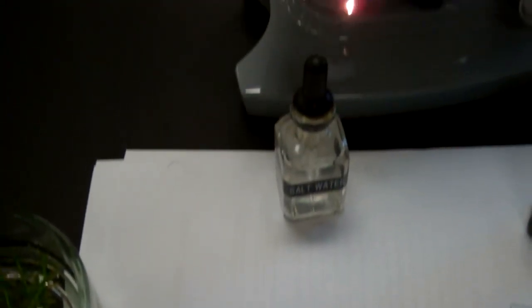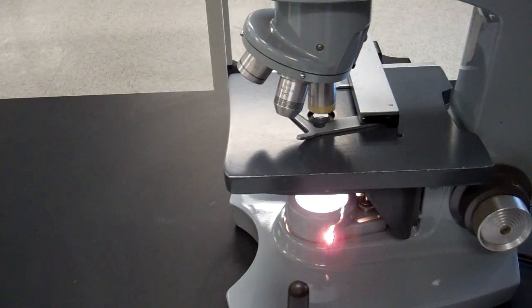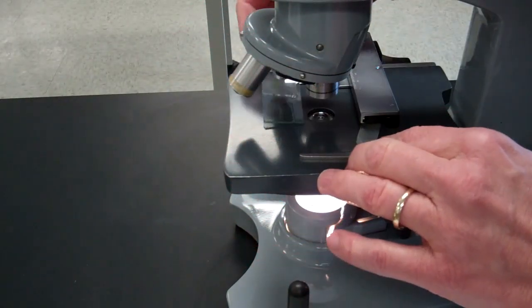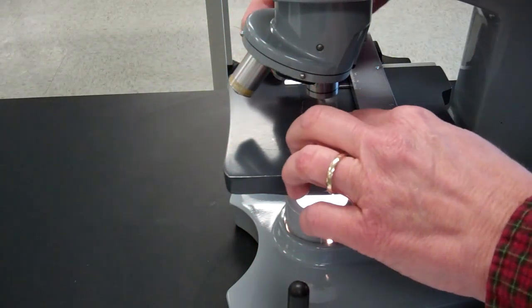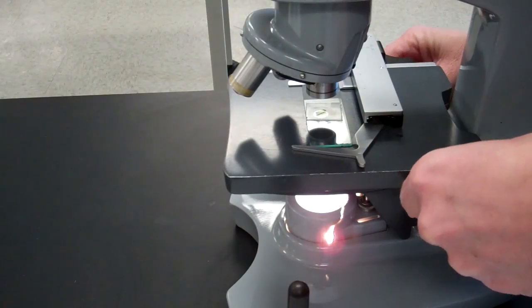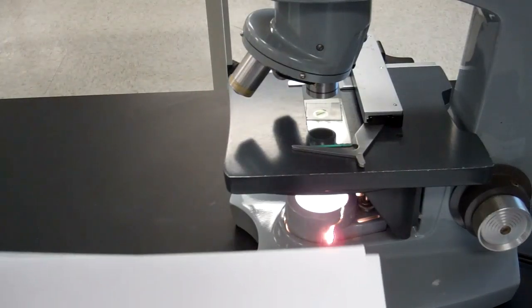So I've got my microscope set up here, and I'm going to put it on the stage, and we'll view it. Center it, and once I zoom in on it and look at it, it's going to look like this. I don't have a hookup for the camera to look inside the microscope, so I'm just going to show you.